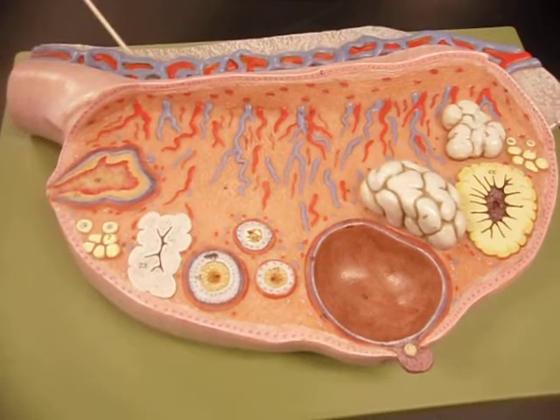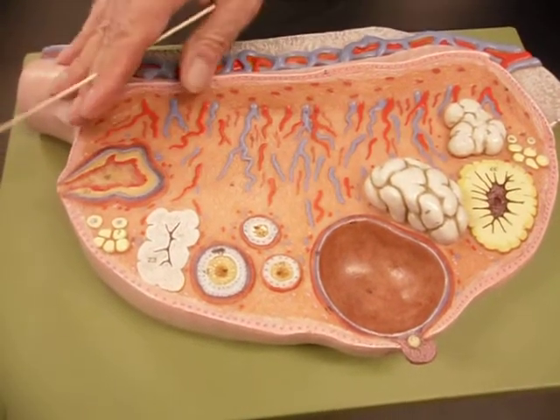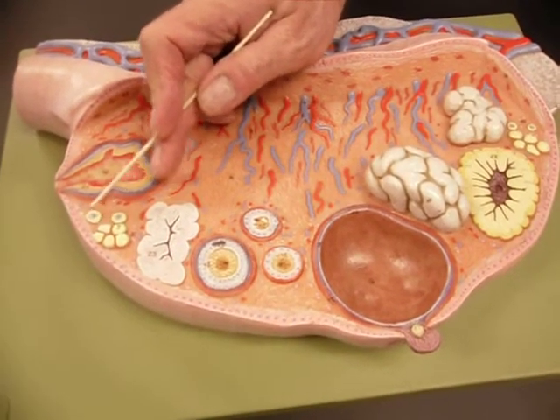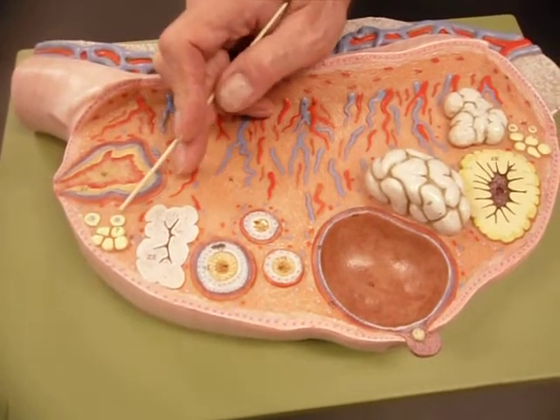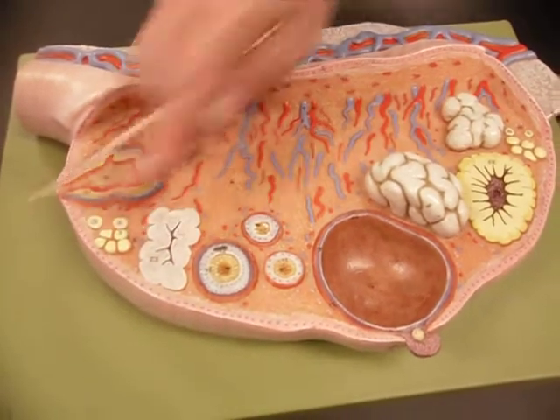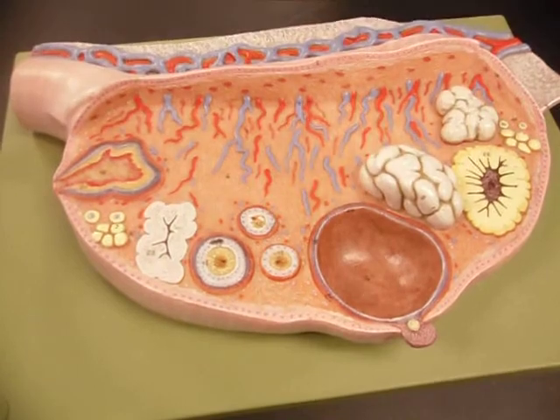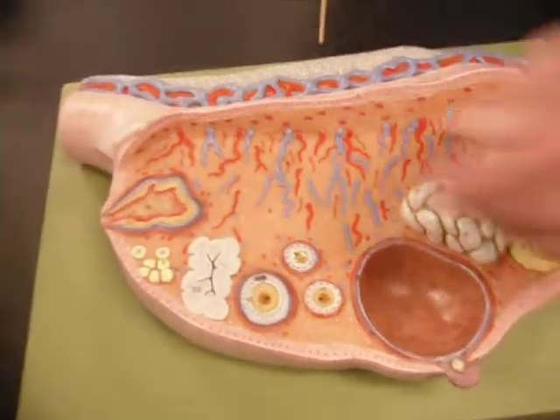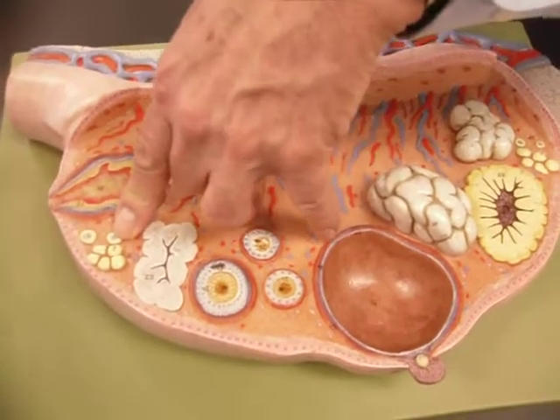All right, now you need to know the different kinds of follicles. These are the smallest and most numerous. When a female is born, she has all of these she'll ever have. Many actually degenerate before she goes through puberty. These are called primordial follicles. You can see a bunch over here. Okay. And you have them by the hundreds of thousands, which obviously means more than you ever need, because each one has a very primitive developing egg cell within it.